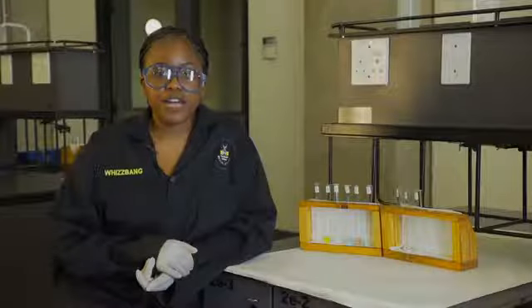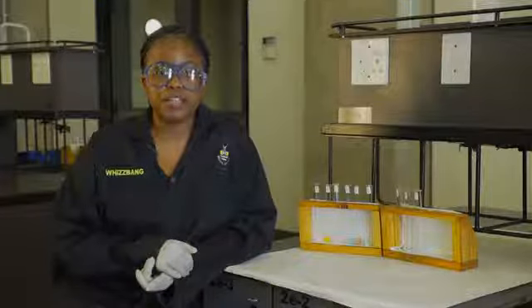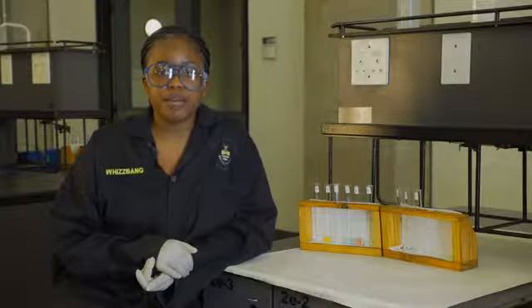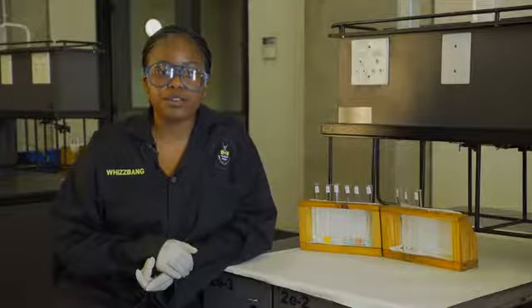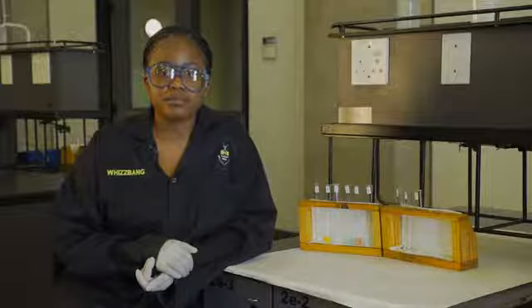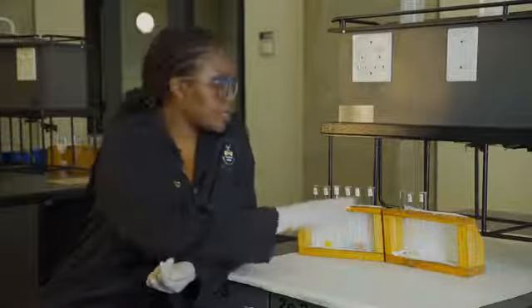In the previous section, we have done preliminary tests to identify the cations present in our unknown salt solutions. I will now be doing more experiments to confirm if our suspicions are correct. In front of me, I have nine test tubes labeled A to I.